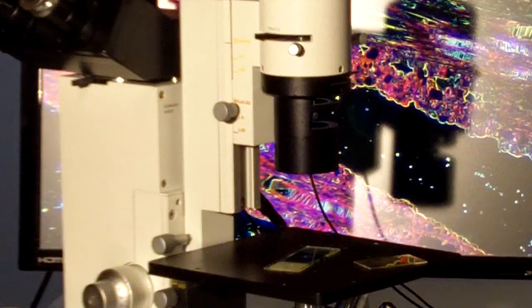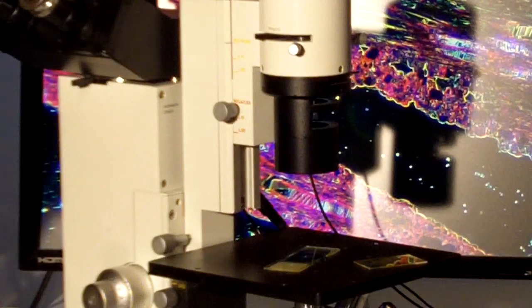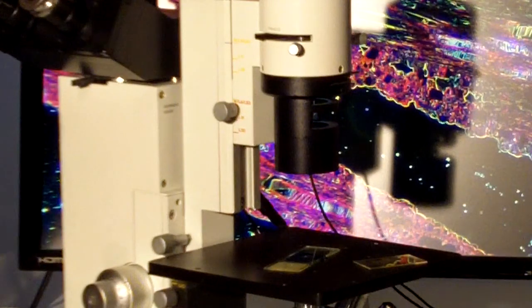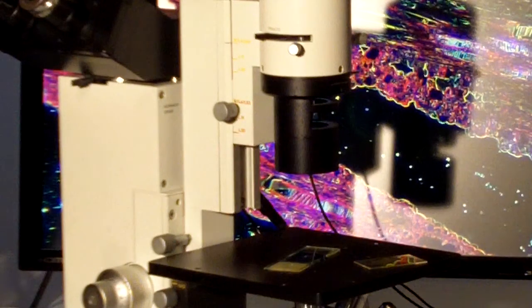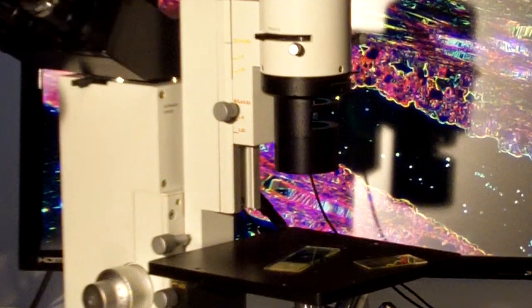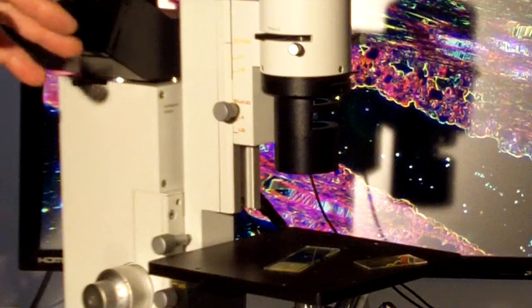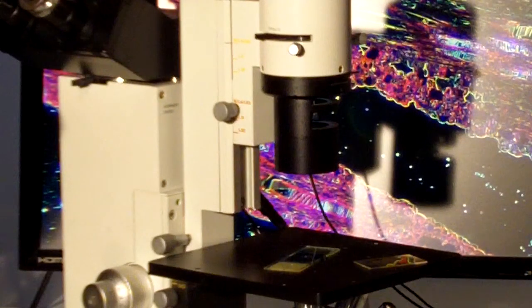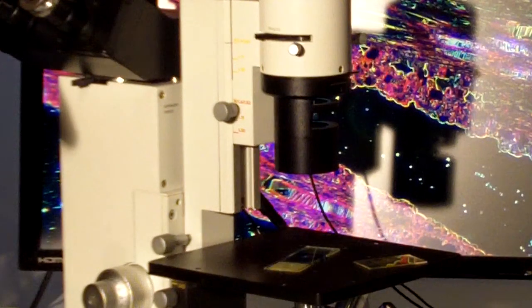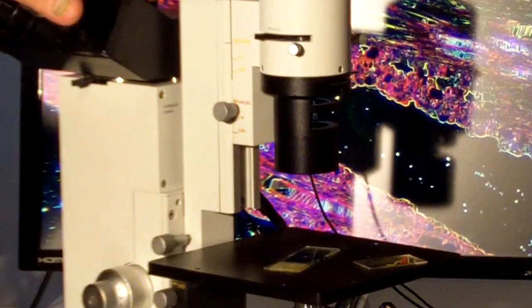So I thank you for listening to the inner workings of the Leitz Diavert. These are still available. We still service them here at Brunton. These are the microscopes that led the way to just about all modern inverted microscopes we see today. This instrument came out in the early 1970s.